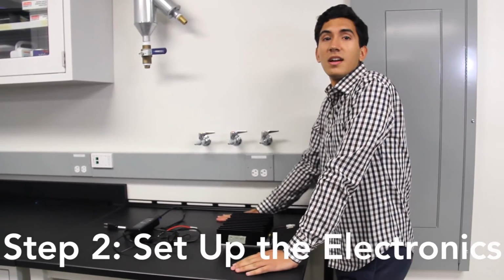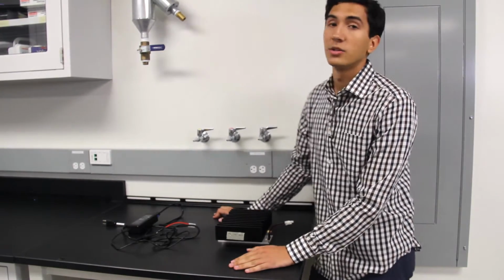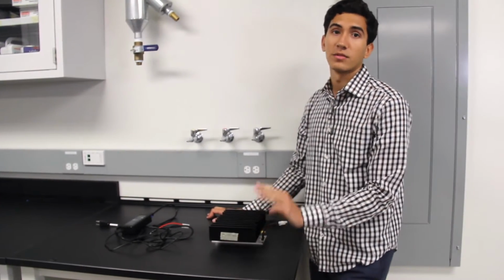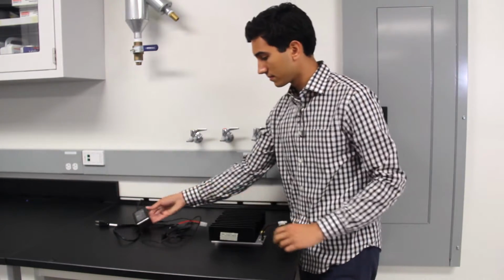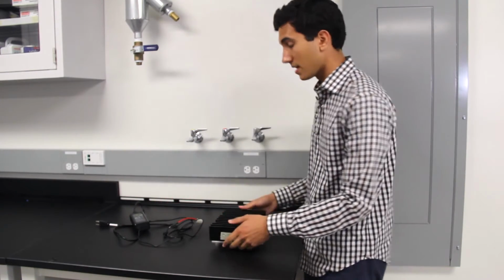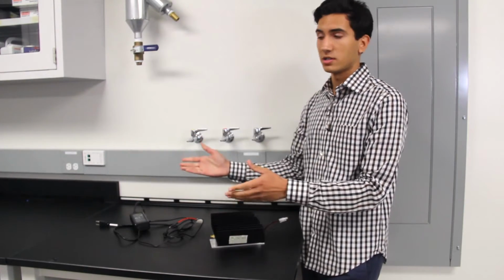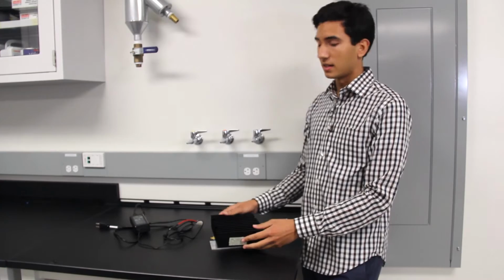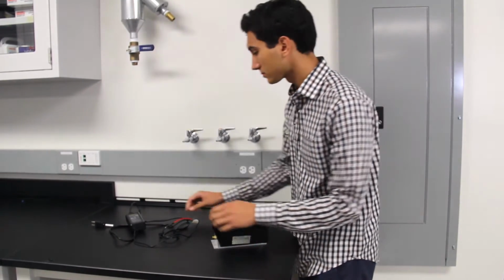So, the next component of our system is the power amplifier. To assemble the PA, you'll require 3 components. First, an AC to DC power adapter, a set of connectors, and 1 power amplifier. Information about where to purchase these can be found on our website, in addition to what power amplifier will be best suited to your application.